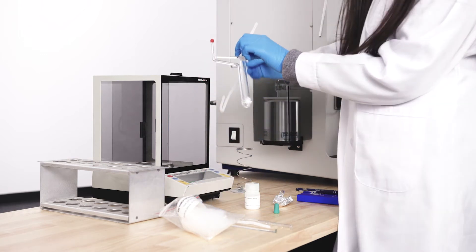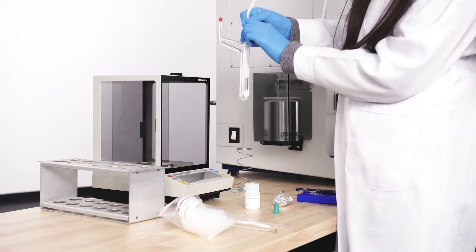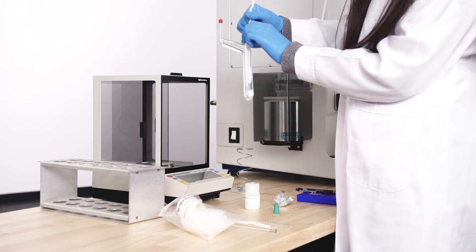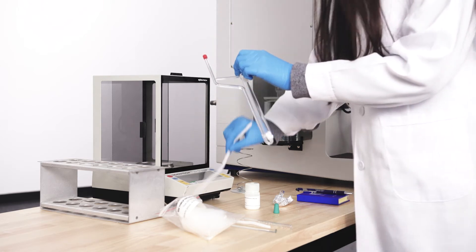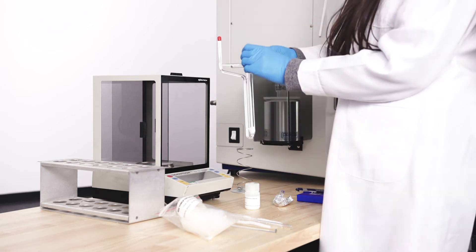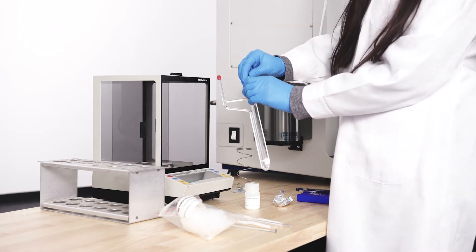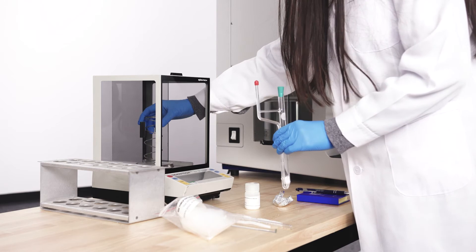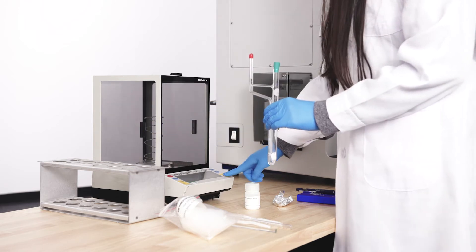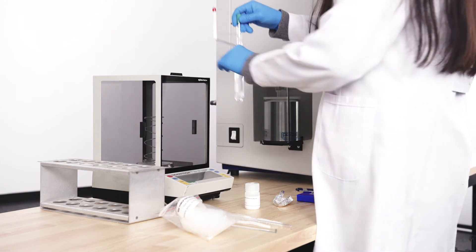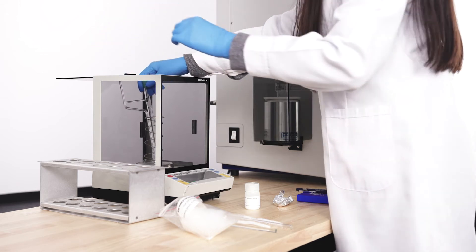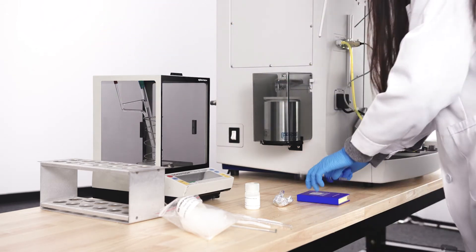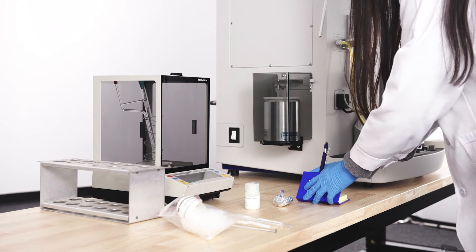Use a pipe cleaner to clear sample off the sides of the sample tube. Weigh the sample plus tube mass with the rubber stopper and record. Use this mass for the report.